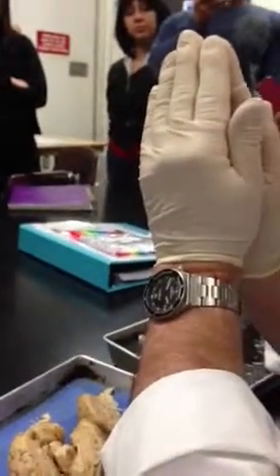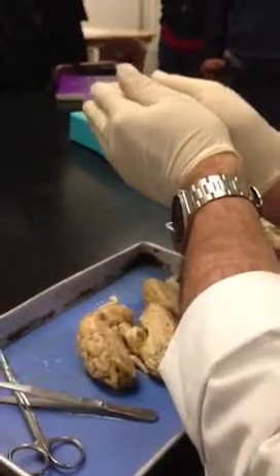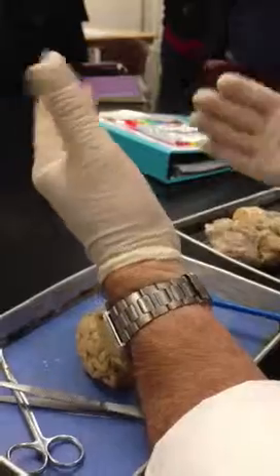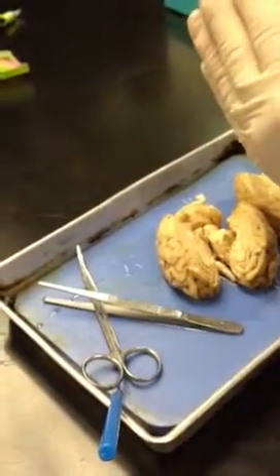So my thalami here have a space in between. That space in between is the third ventricle. So the third ventricle is formed by the walls of the thalamus. So when we cut it, it's like, oh, where'd the third ventricle go? It's gone, because you sliced right through it. So here's the thalamus, there's the thalamus. The space in between when they were together was the third ventricle.